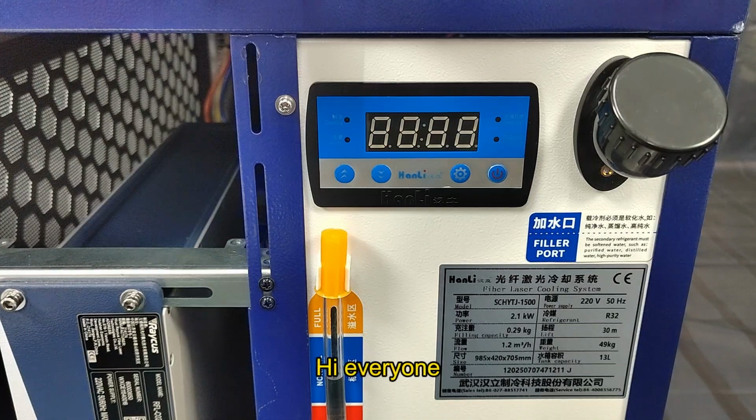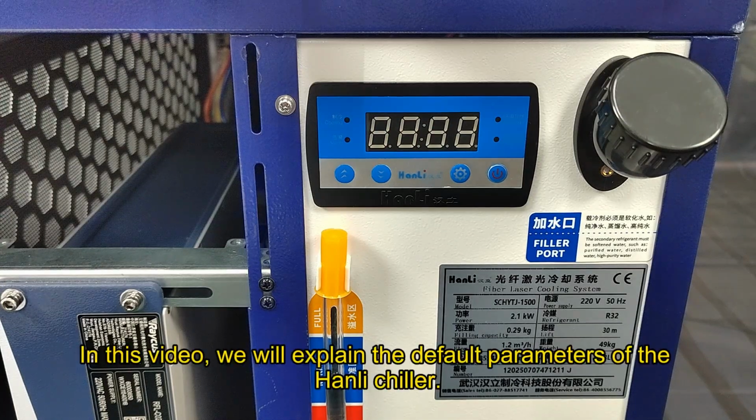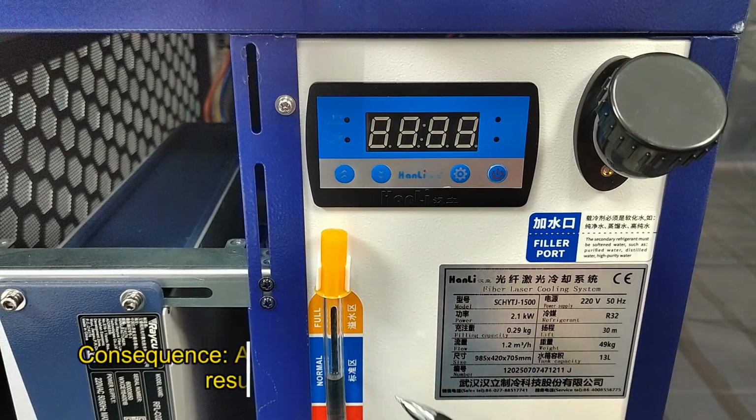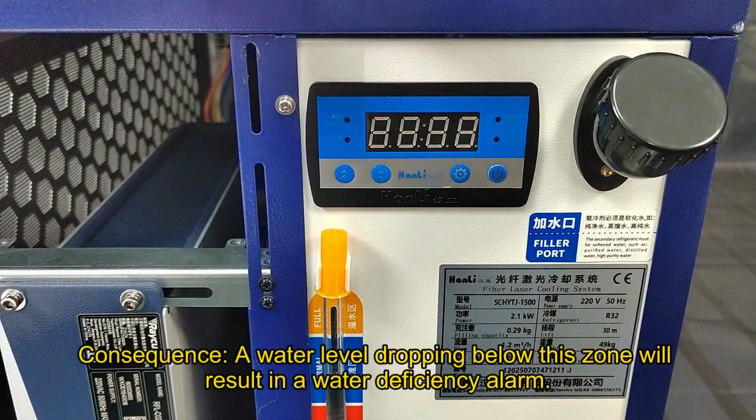Hi everyone! In this video, we will explain the default parameters of the Hanli chiller. Requirement: during chiller operation, ensure the water level remains in the normal marked zone. Consequence: a water level dropping below this zone will result in a water deficiency alarm.